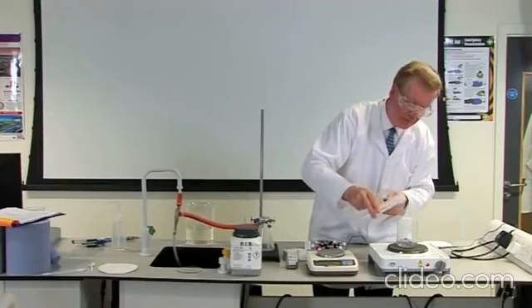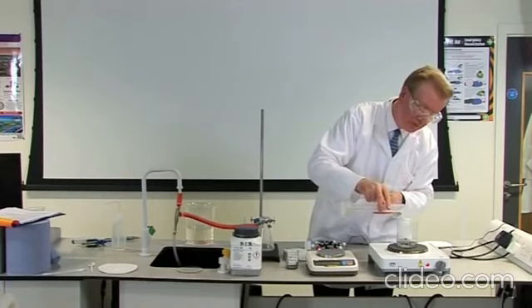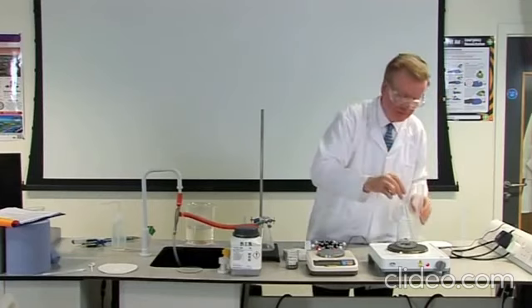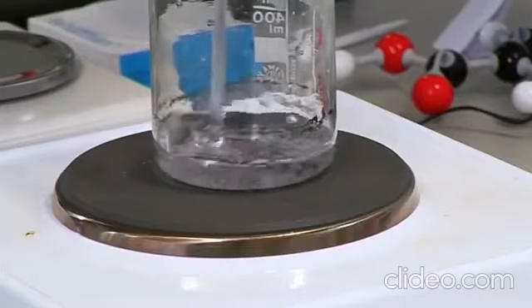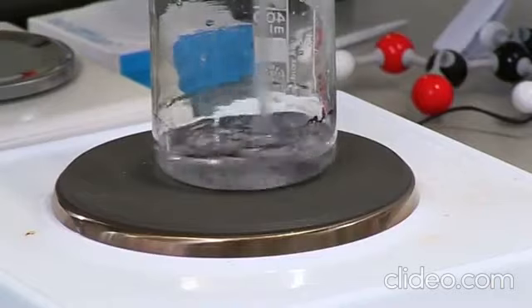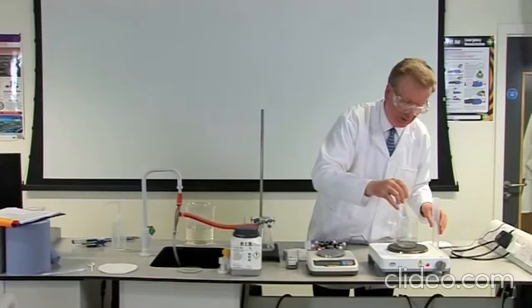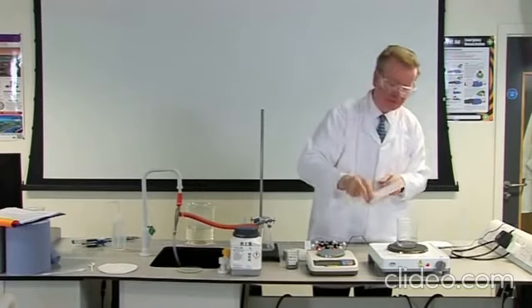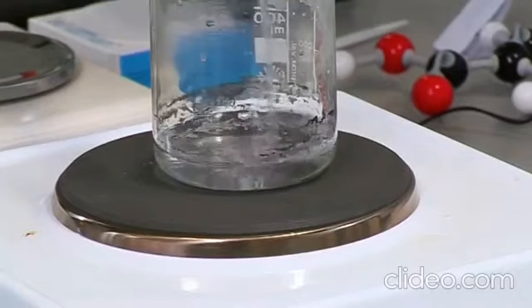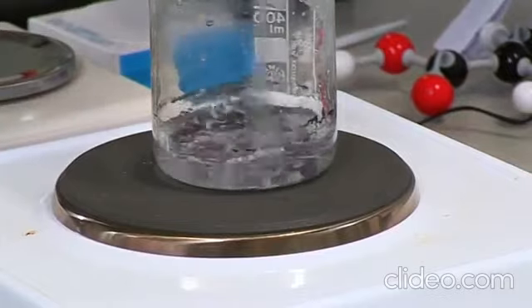Continue to add 10 cubic centimeter portions of water to the boiling water in the beaker until the benzoic acid has dissolved. That is, until you can no longer see any of the white solid. Only the specks of impurity, for example charcoal, will be visible in the water. While heating the water, keep the solution well stirred with the aid of a stirring rod.